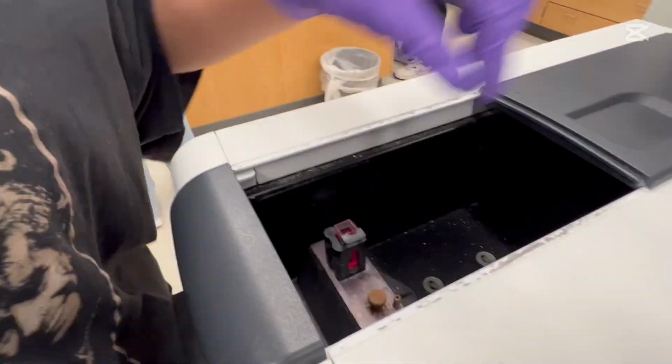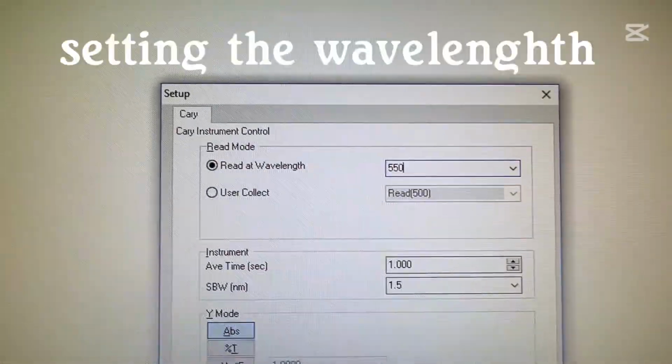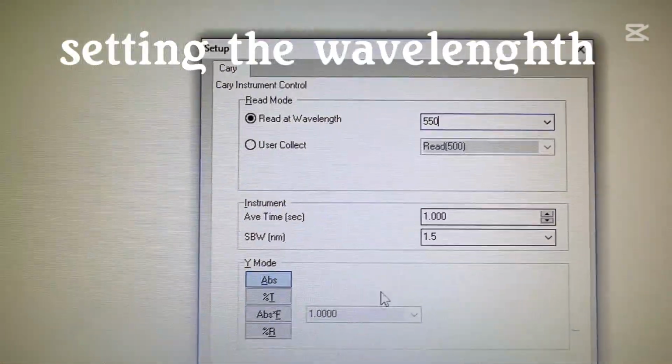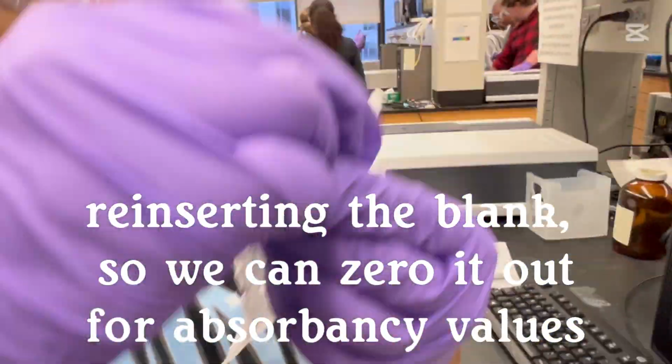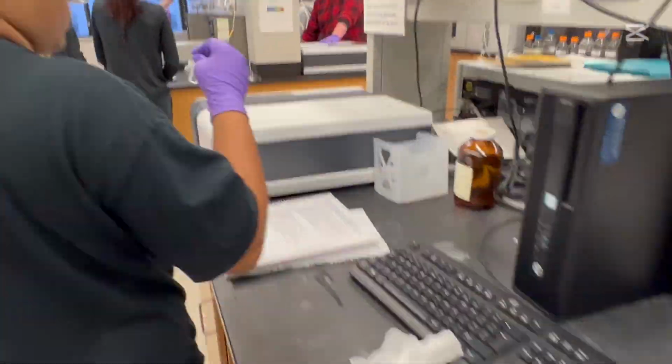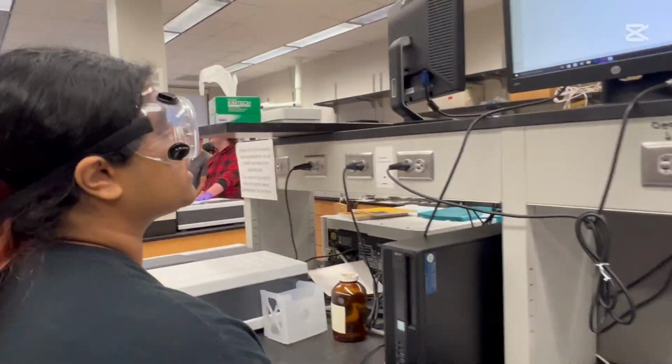Let's take it out. Okay. This is our lambda max, so that's why. So now I'm taking our blank. I'm going to wipe it down. Excuse me. Wipe it down. And I'll have to close. And then I'm going to press 0.